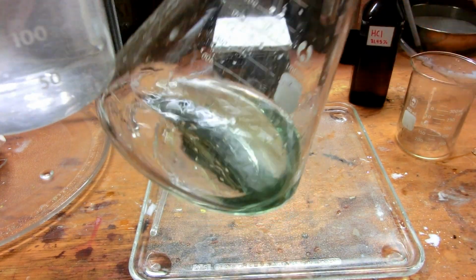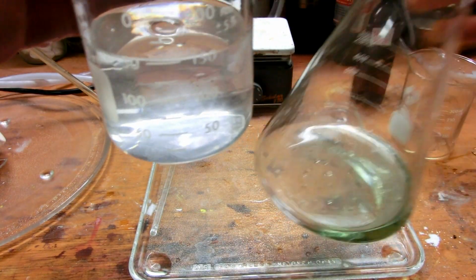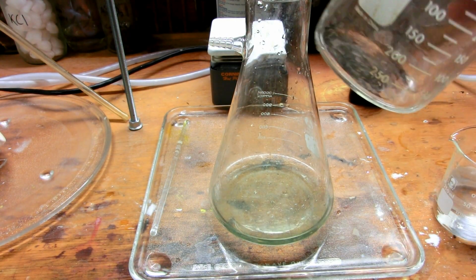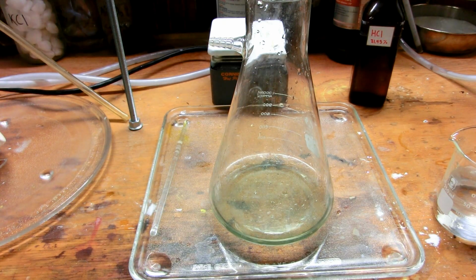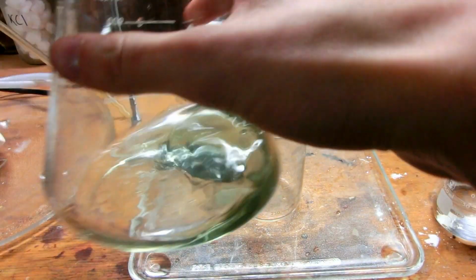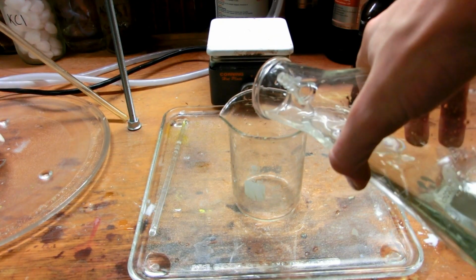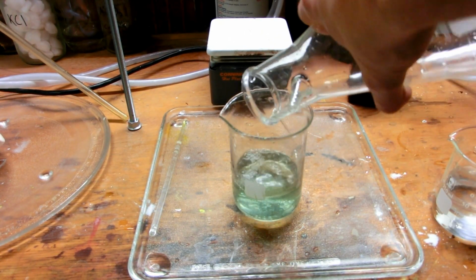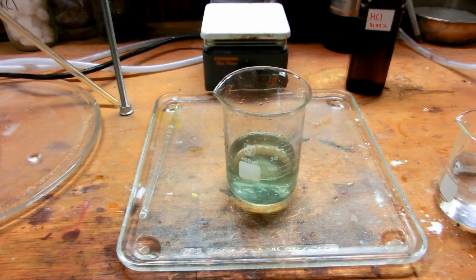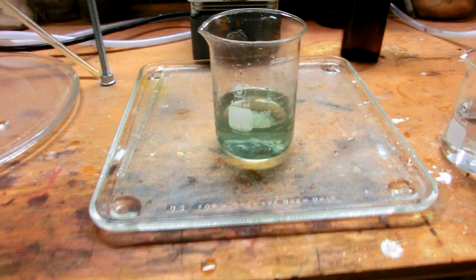So, here's our ferrous chloride, and here's our oxalic acid. And I'm going to pour them together in a separate container. I'll use this beaker, but I'll just rinse it really fast. Okay, so here I got this beaker, and we're going to pour our ferrous chloride into it. It's a pale blue, kind of green solution. And if we leave our ferrous chloride out, it will actually oxidize to ferric chloride in the presence of air and iron, so it'll turn like a sludgy, nasty brown.